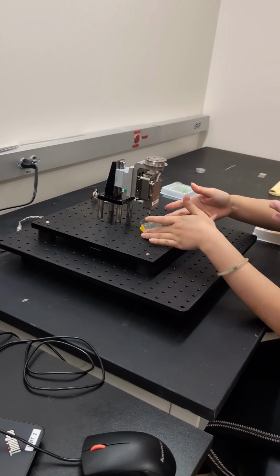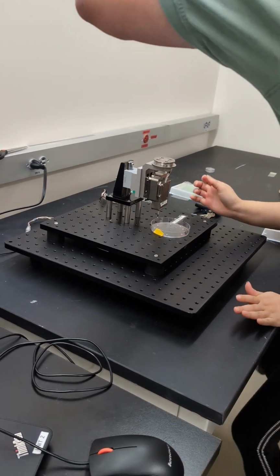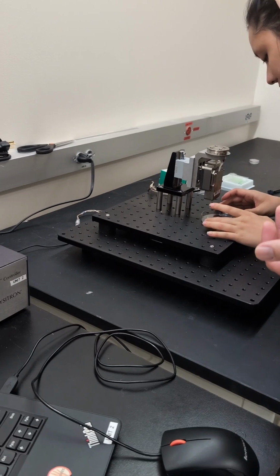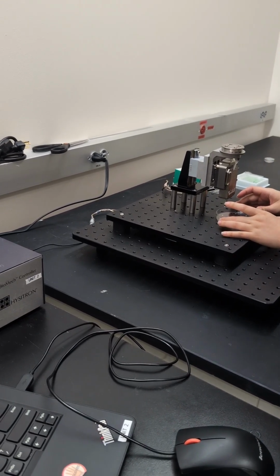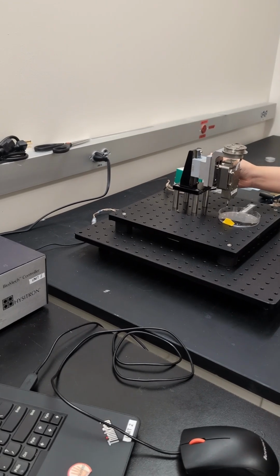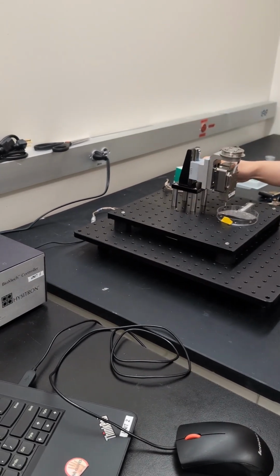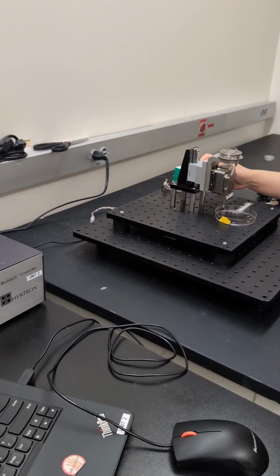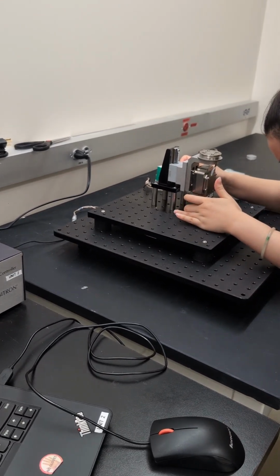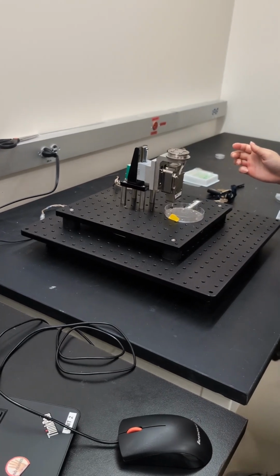And then find the next hydrogel you want to work with. Maybe easier if you stand up, so you can actually see from the top if it's rightly centered, and once you feel like the probe is going to hit the hydrogel, you can slowly lower it down. If you feel like this is too slow, you can unlock the lever, but with the lever unlocked, it's getting light, so it can potentially fall. So try to avoid exerting too much force onto the whole housing. It's a bit janky.